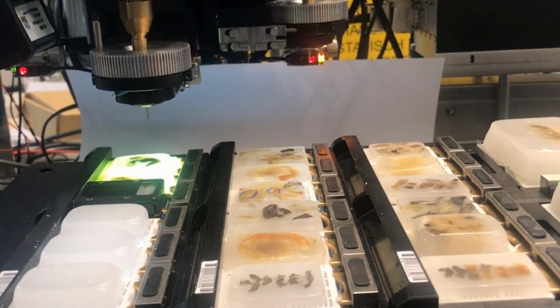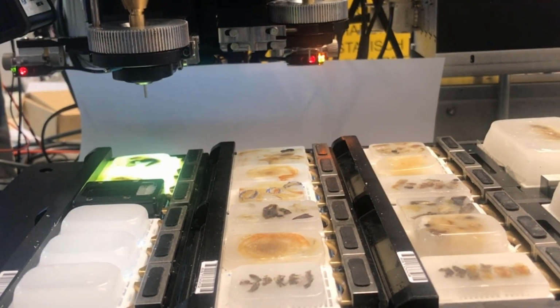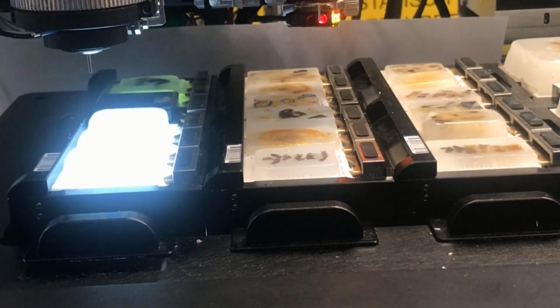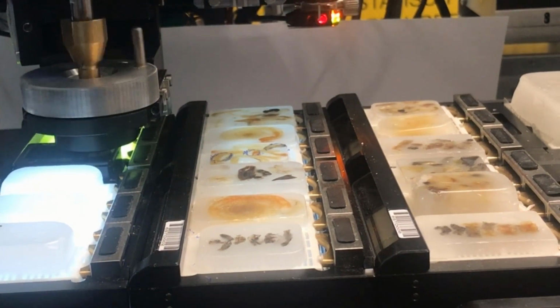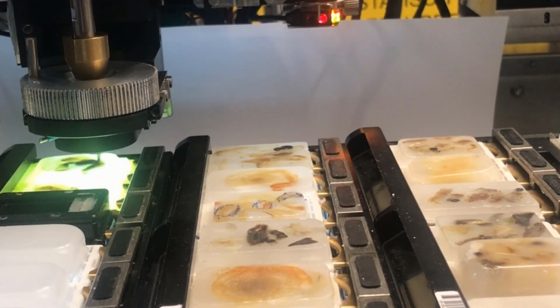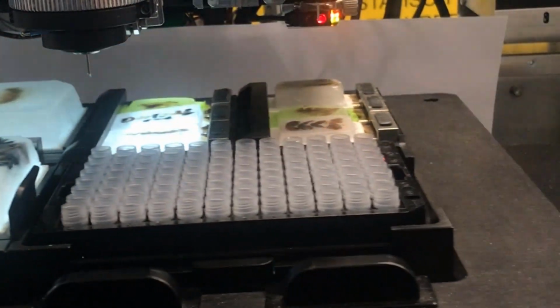If the sensor mechanisms detect that the tissue core is not in the needle, the tissue extraction is repeated, increasing the static compression force. This control is exclusive of the GalileoTMAtic, ensuring that all cores are extracted and placed into the recipient block. In case a microfuge plate is used as a recipient, Galileo will pick and place the tissue core into the selected tube and then clean the needle.